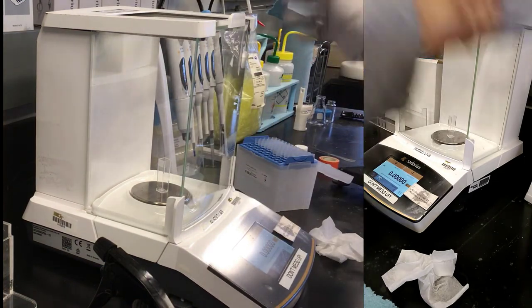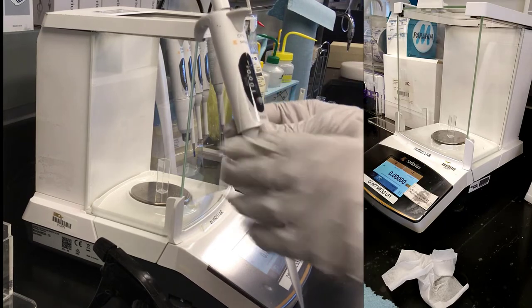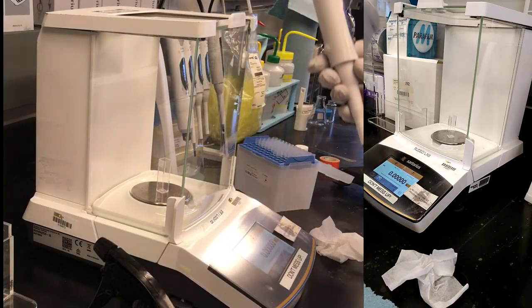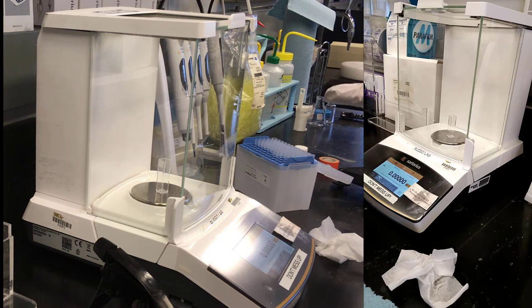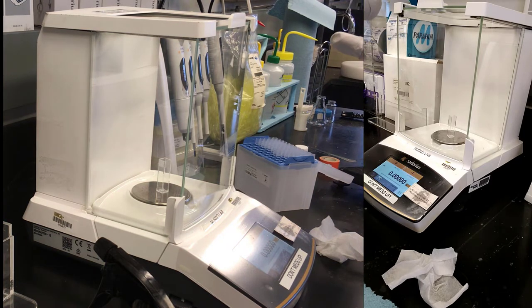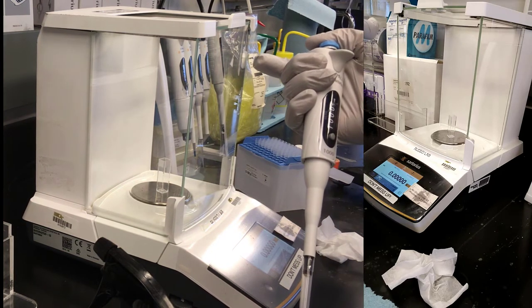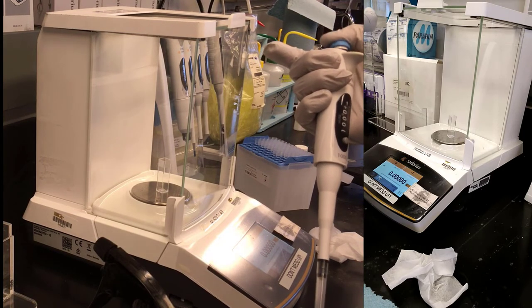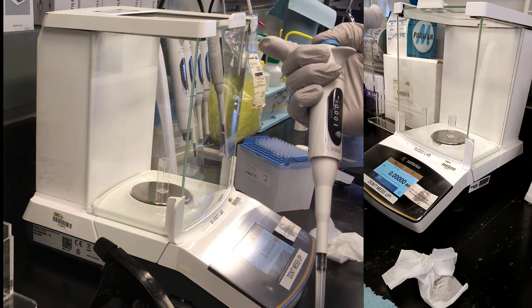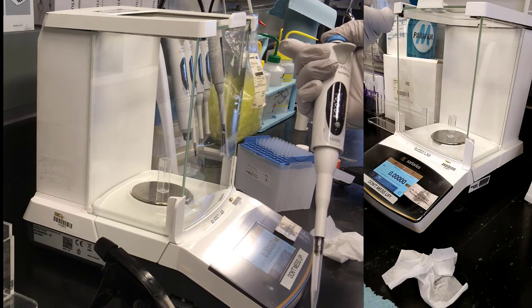We're going to add 1 mL to the sample, and this should come out as adding a gram. Now, when you use these devices, the trick is, I'll squeeze it out again and start fresh. Notice that they have a push there and then a push all the way down. There's a stop. You can't feel that stop, but trust me, there's a stop there. I guess I can hear it. When I push all the way down, then I eject everything. But the light push point is when you get 1.000 mL.